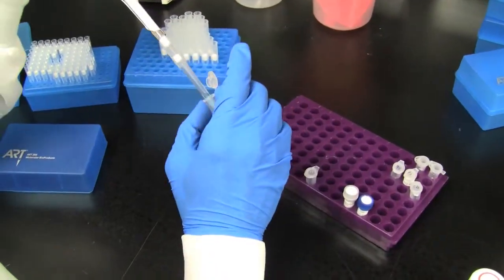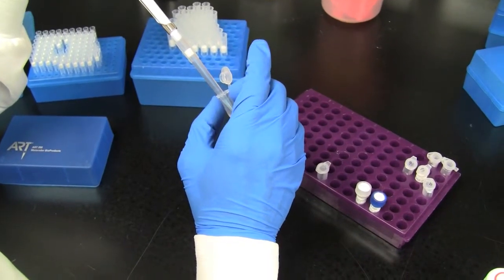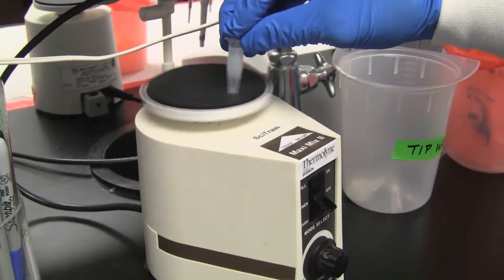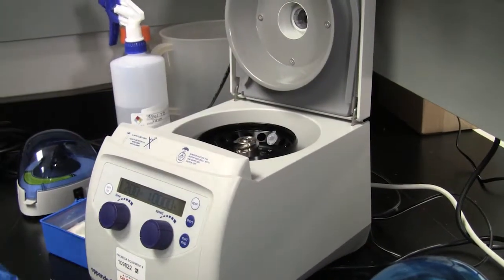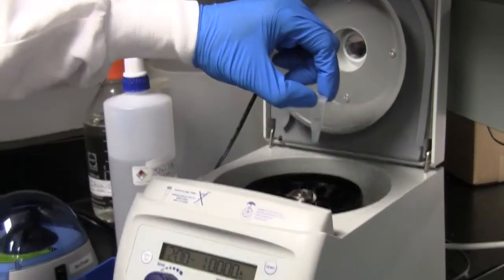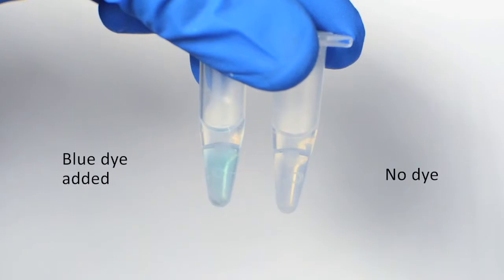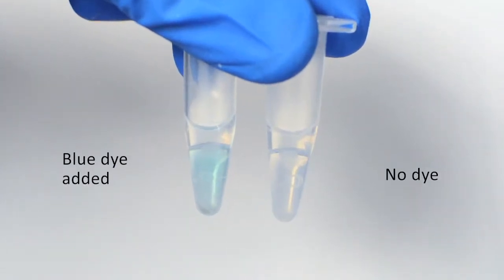Add 250 microliters of master mix to each sample tube and vortex for 5 seconds. Centrifuge the samples at 10,000 G for 20 seconds to separate the layers. The blue dye allows easy visualization of the lower aqueous layer.